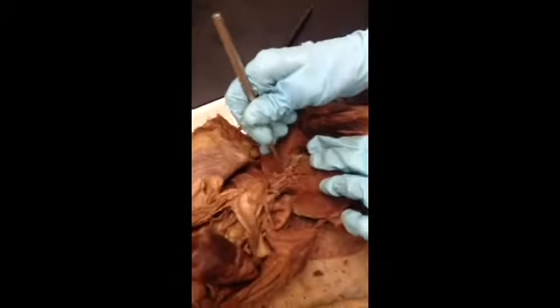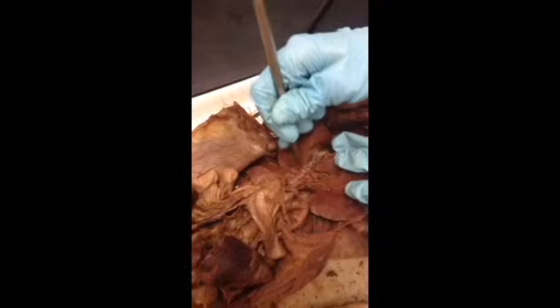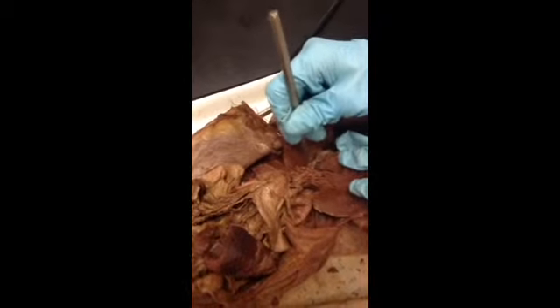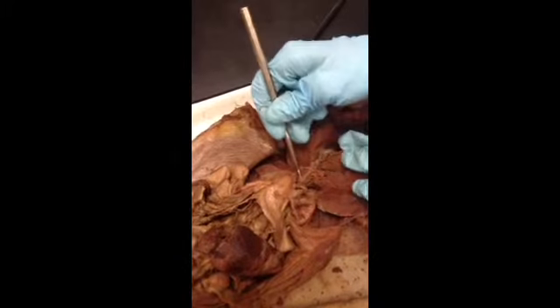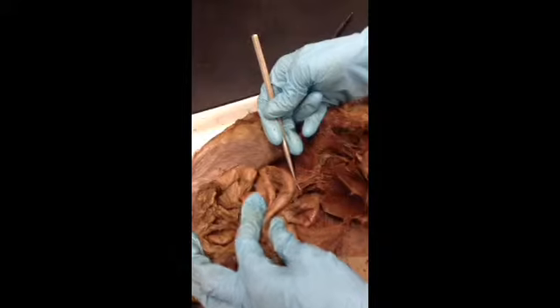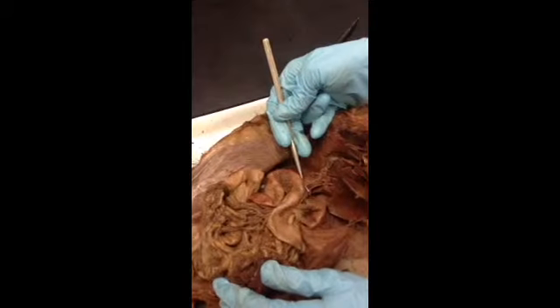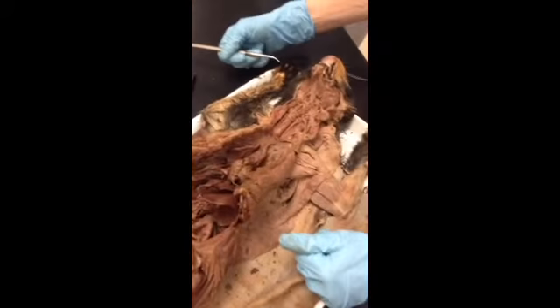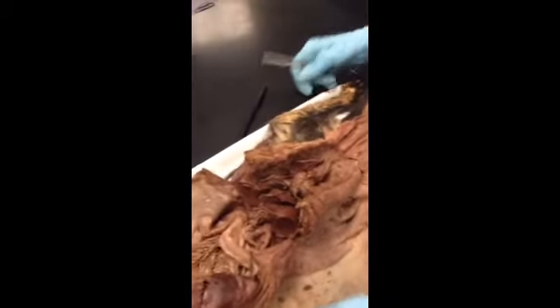Anyway, the cystic duct right here coming down from the gallbladder. It's joined by ducts coming over from the liver. These are hepatic ducts. And those combine into one big tube called the common bile duct. And that comes in right at the beginning of the duodenum. Okay? I think we're good with that. Okay? All right.